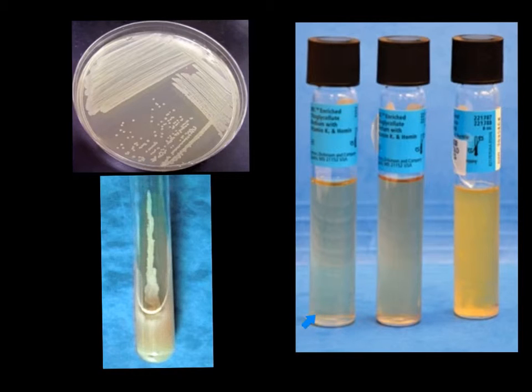So we want to thump the test tube several times, thumping this so that we can get this moving in a swirling motion and get the bacteria that's down here to mix up all the way through the solution.